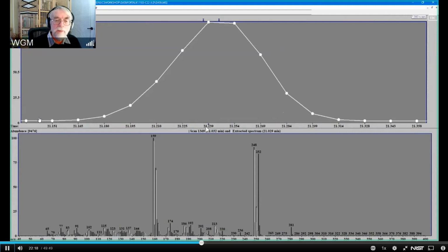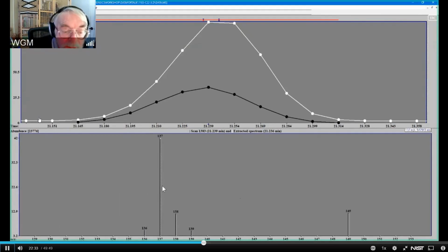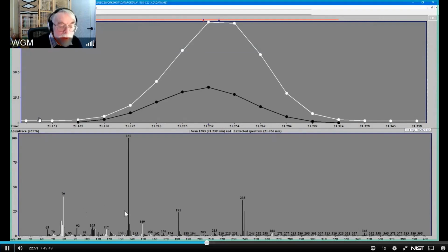And as I said before, we can look at the individual components. I'm going to blow this up so you can see it. It's a little hard to see that this is dashed. It's even harder to see it here than it was before, I think. But that's okay, because I can tell it not to show the uncertain peaks, and then it only shows me the peaks that it's confident of. So for this component, these are the confident peaks.